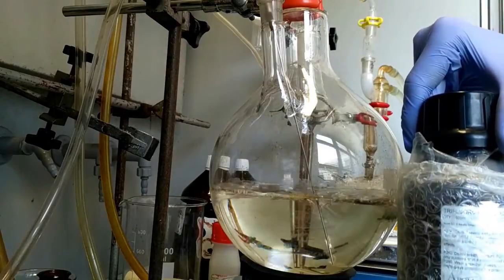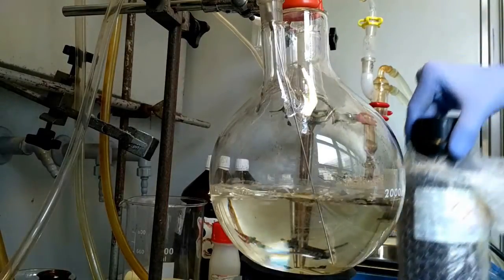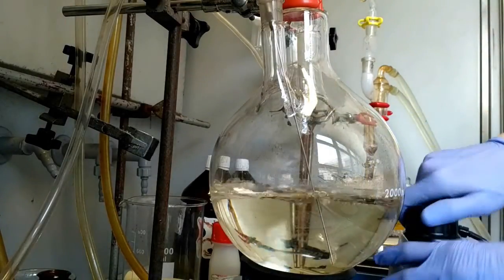And a catalyst, trifluoroacetic acid, is also added to the reaction mixture. It's very toxic and dangerous.